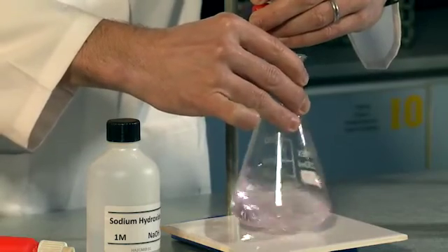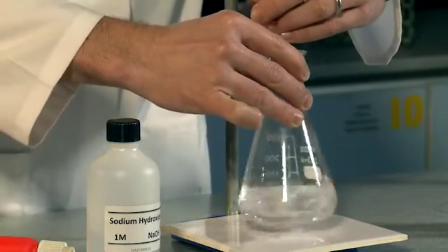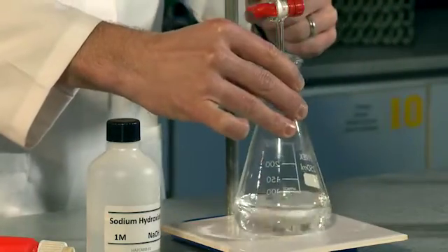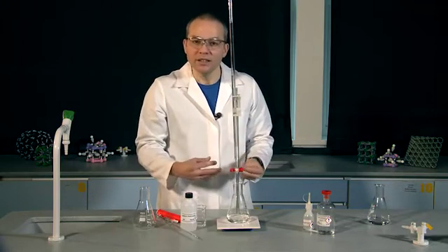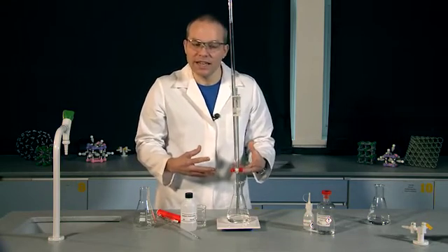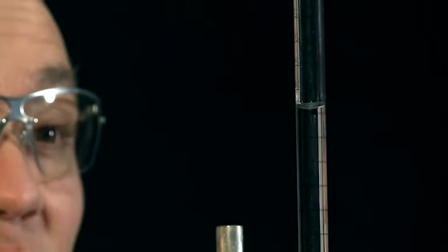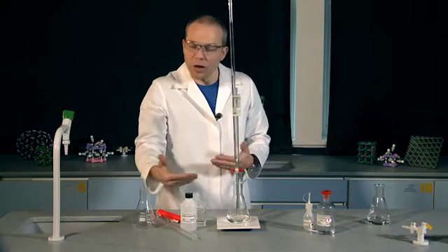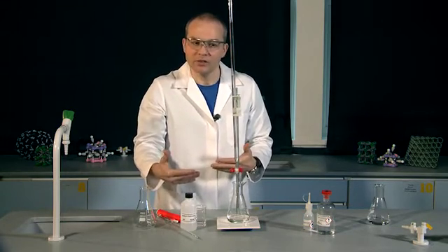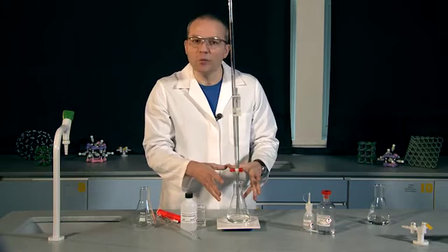Nearly there, and it's gone. Now I'm very confident that that's a much more accurate measure of the volume of hydrochloric acid that I need, and so that is 25.8 cm³. In that first titration I did go quite a long way past the end of the titration, but I'm now far more confident of my volume.